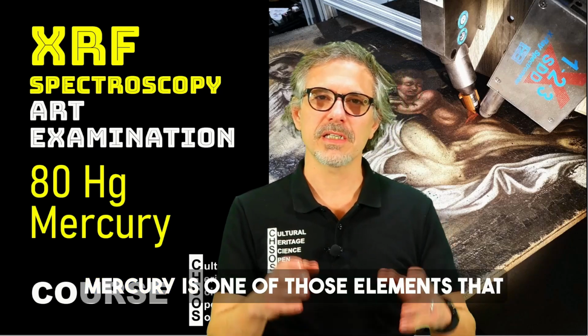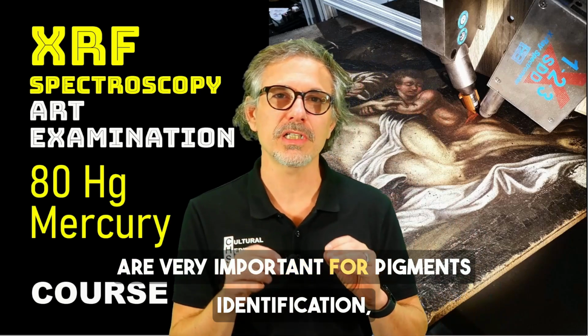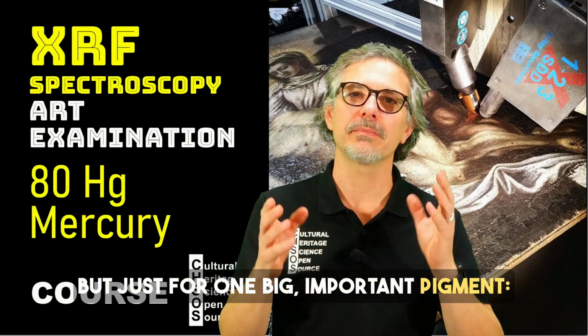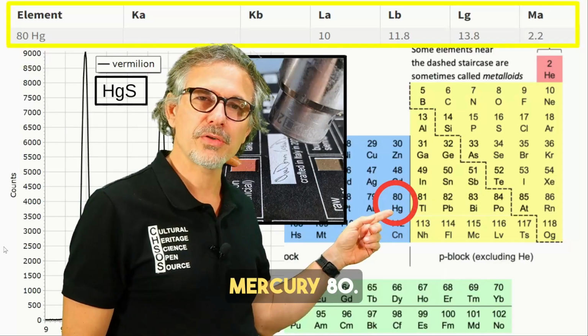Mercury is one of those elements that are very important for pigment identification, but just for one big important pigment, vermilion, mercury sulfide. Mercury 80.